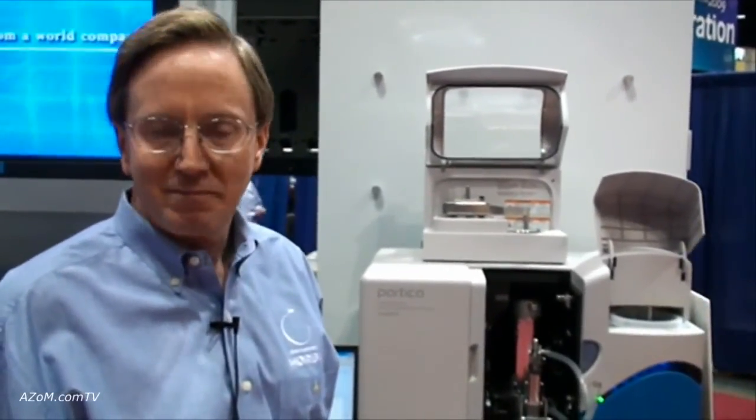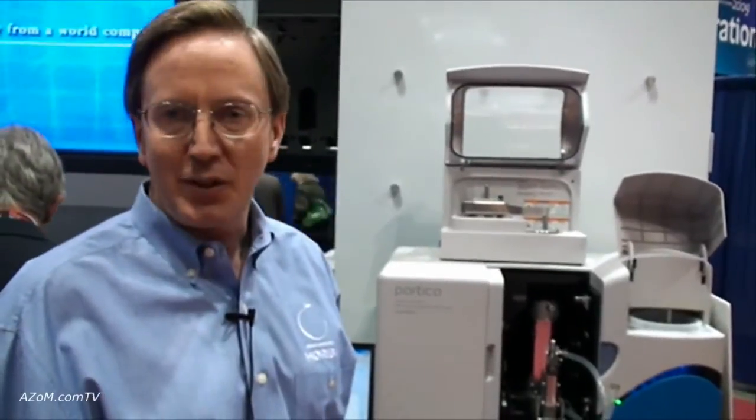Thanks very much for taking us through the Partica Particle Size Analyzer. Very glad to — thank you. We look forward to working both with you and any customers who choose to work with Horiba.